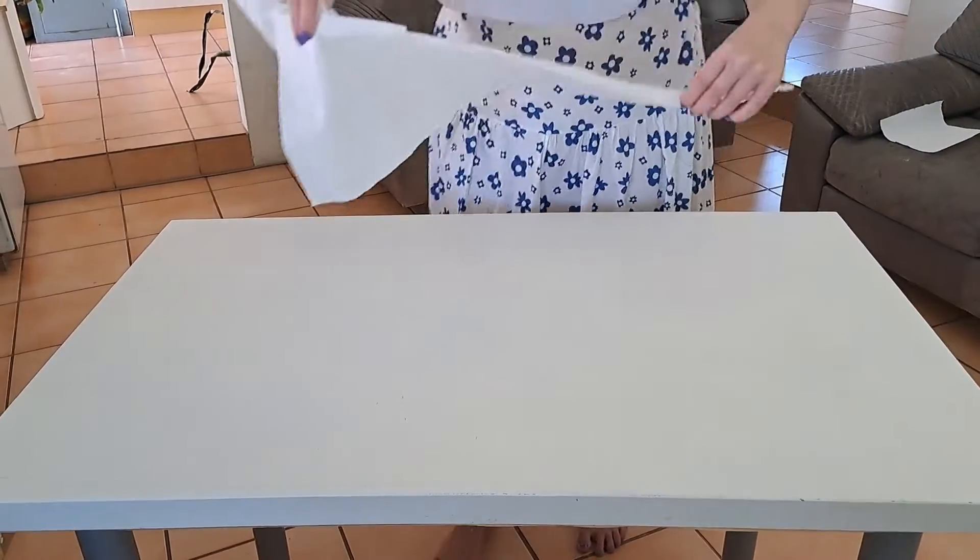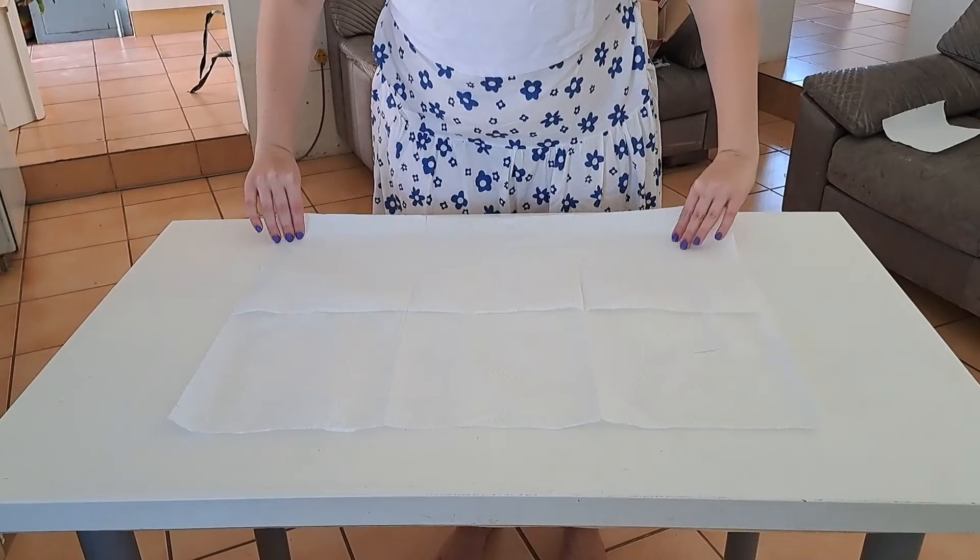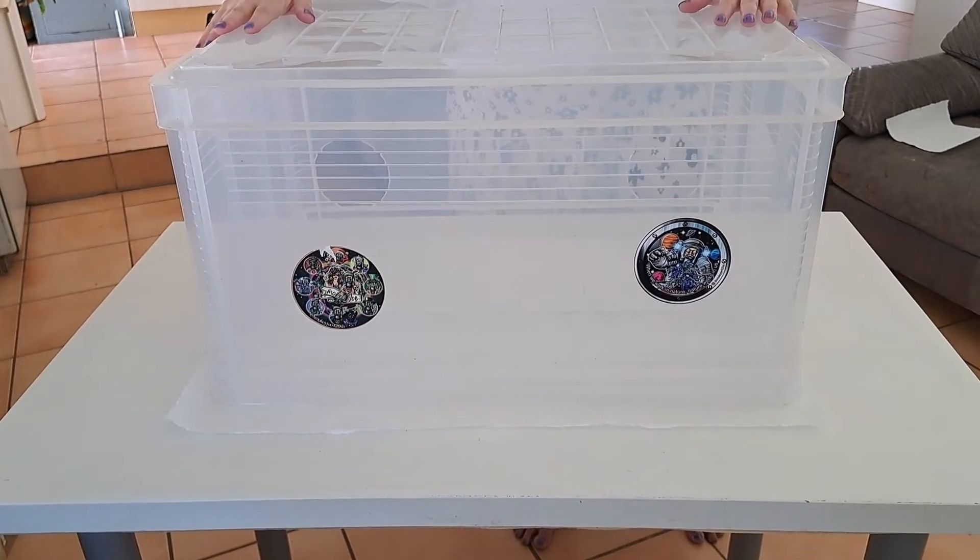I will put six paper towels on top of the table. The reason I use paper towels is because you want anything airborne inside your still air box to sink down and stay down. When you spray rubbing alcohol in the box it pushes everything airborne down because it's denser, and then the rubbing alcohol on the paper towels at the bottom captures and holds that, so mold spores aren't floating around. I place the still air box on top of the paper towels with an edge of paper towel sticking out all around, so it's completely sealed at the bottom and no airflow can come in.